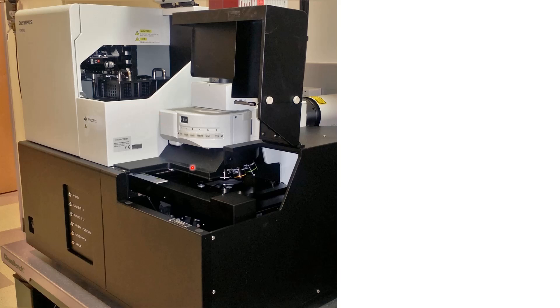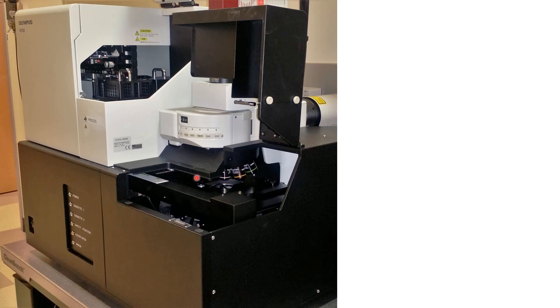And you can see the objectives here. So you can see that it is an upright microscope where the light, the bright field light comes from the bottom and goes into the camera up here. And if you see that the slides are supposed to be kept in such a way that the coverslip is facing towards the top.